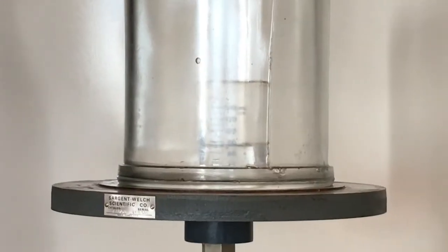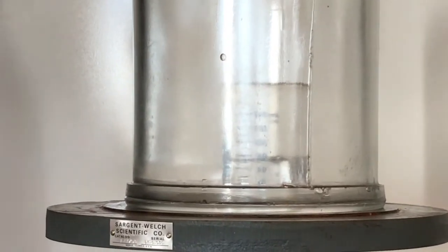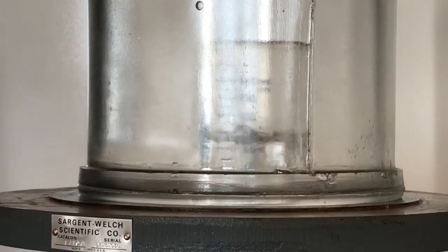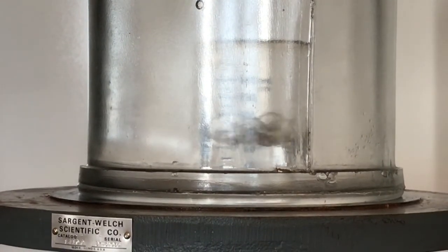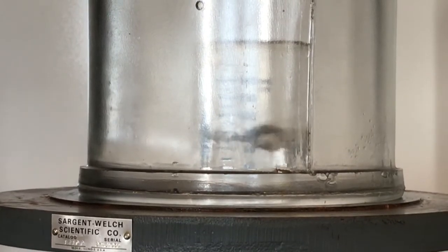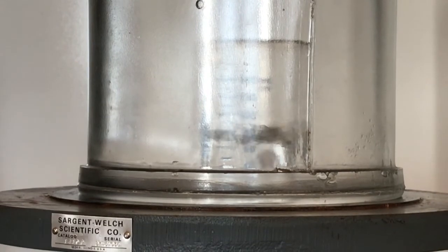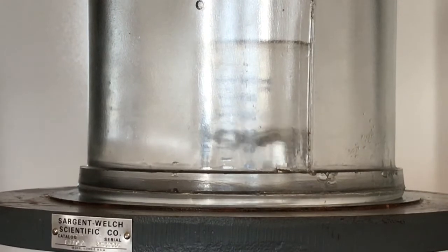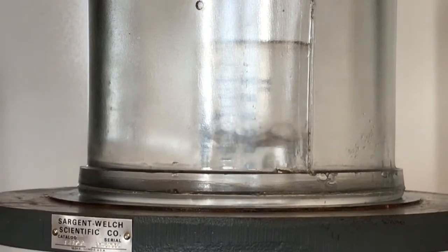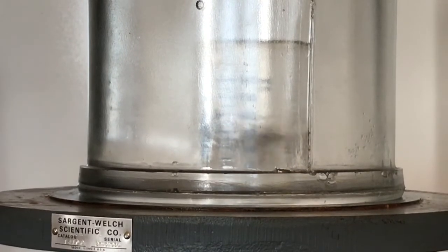So we're getting some boiling, we're getting some bubbles to form. So now the tert-butyl alcohol is in full boil. Keep your eyes on it. Here we go.